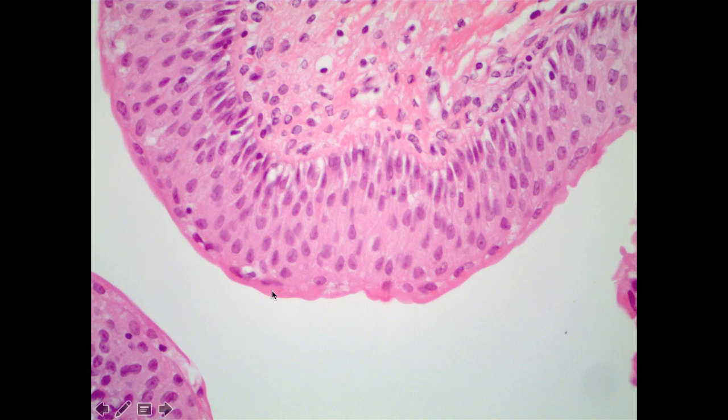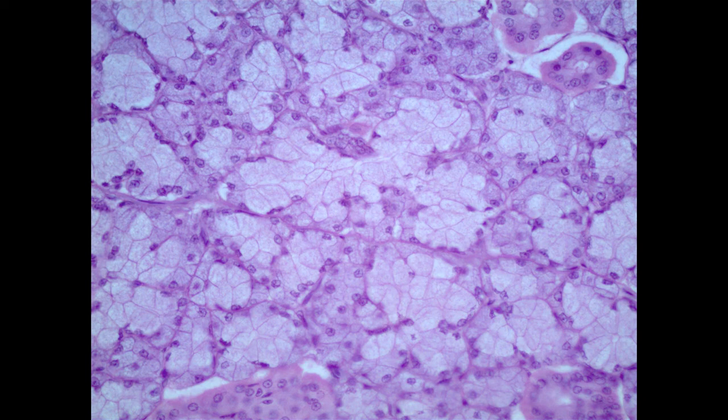And the truth is that the surface cells will change dramatically depending on if this is stretched out or if it's relaxed. And in this example we see here, it's pretty relaxed. These surface cells are kind of cuboidal shaped. They're not really flat, not nearly as flat as we just saw. And so this ET layer that's stratified, but that can change the surface cell shape based on stretching, is referred to as transitional ET.